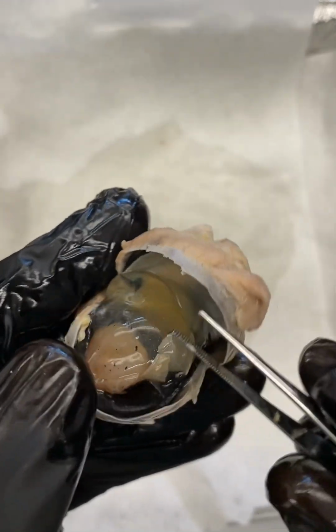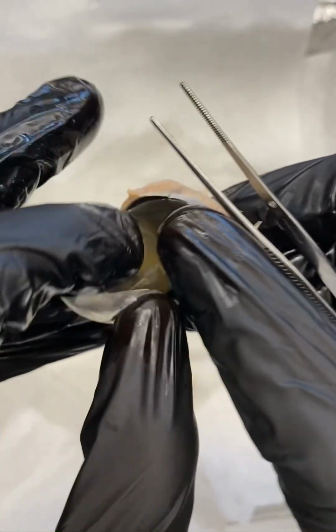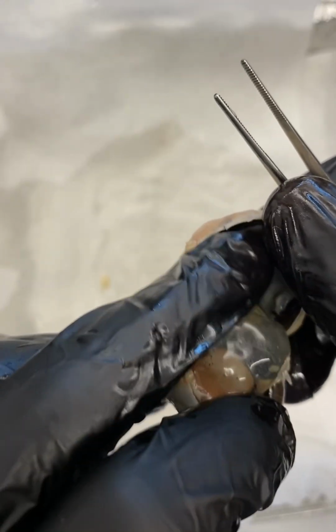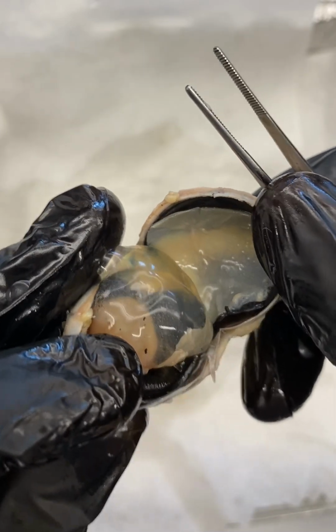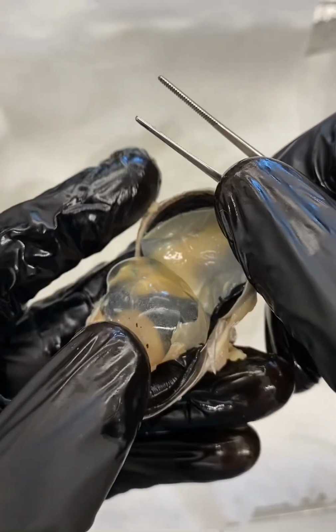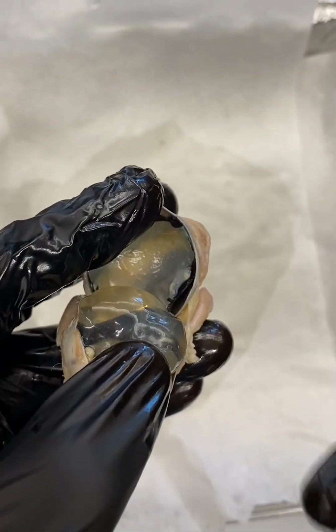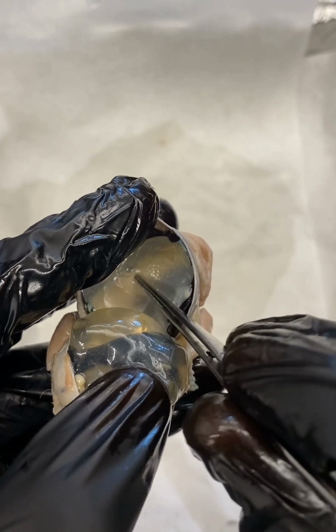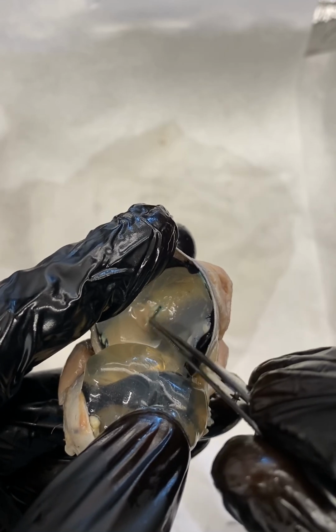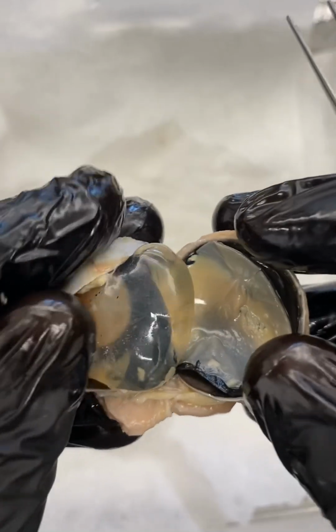And what it's doing is it's doing a few things. One, it's helping to keep the structure of the eye. Sorry, I'm trying to keep this open. It's helping to maintain and preserve some of the structure of what's called the posterior region, or this posterior chamber of the eye. It's also helping to keep this yellow tissue that you see here, all of this yellow tissue at the tip of my pointer. This is the retina. We alluded to the retina earlier, but all this yellow tissue is the retina. You can kind of move it and peel it, and we'll peel it in just a little bit. It's helping keep that pushed up against the back of the eye.